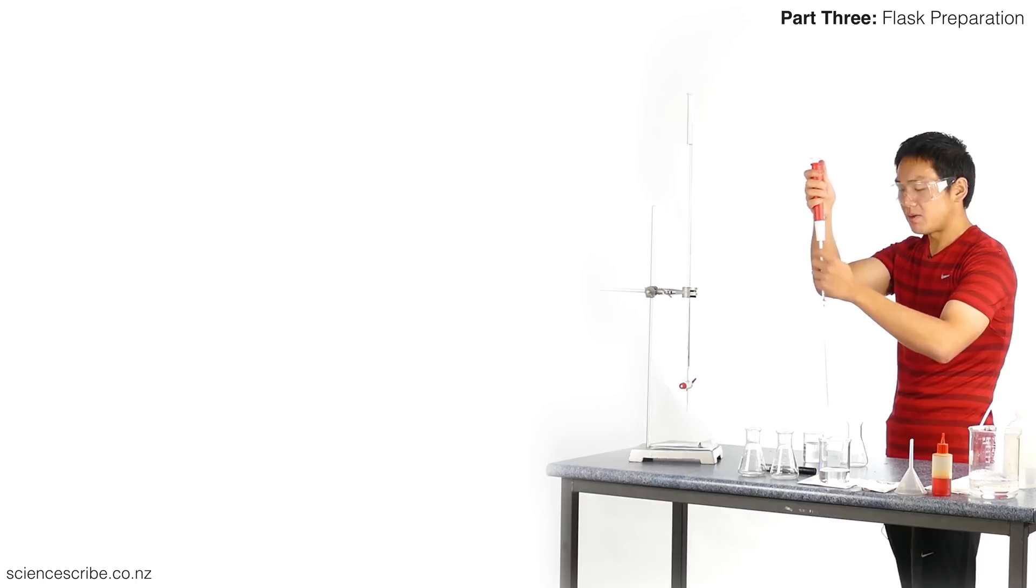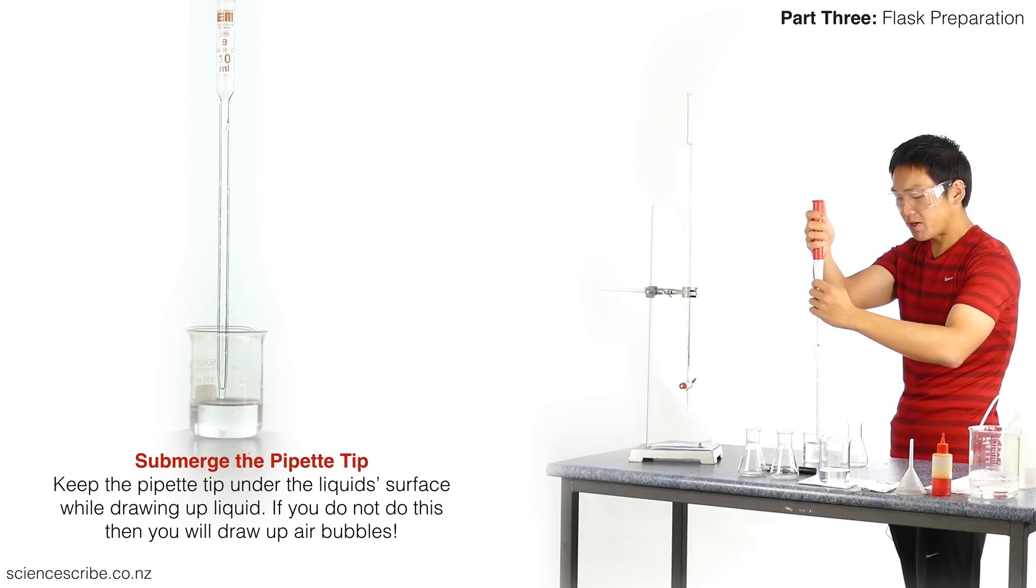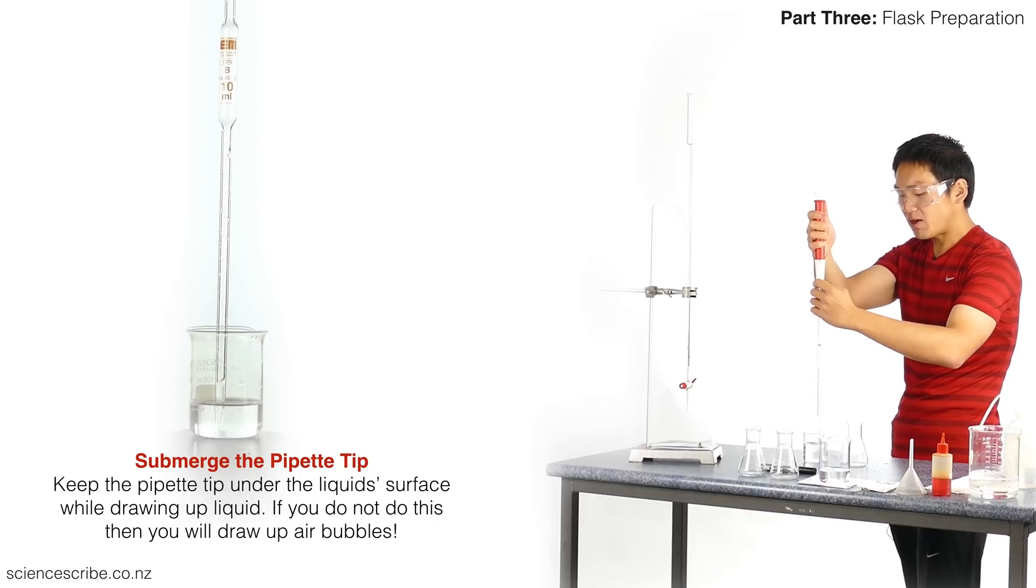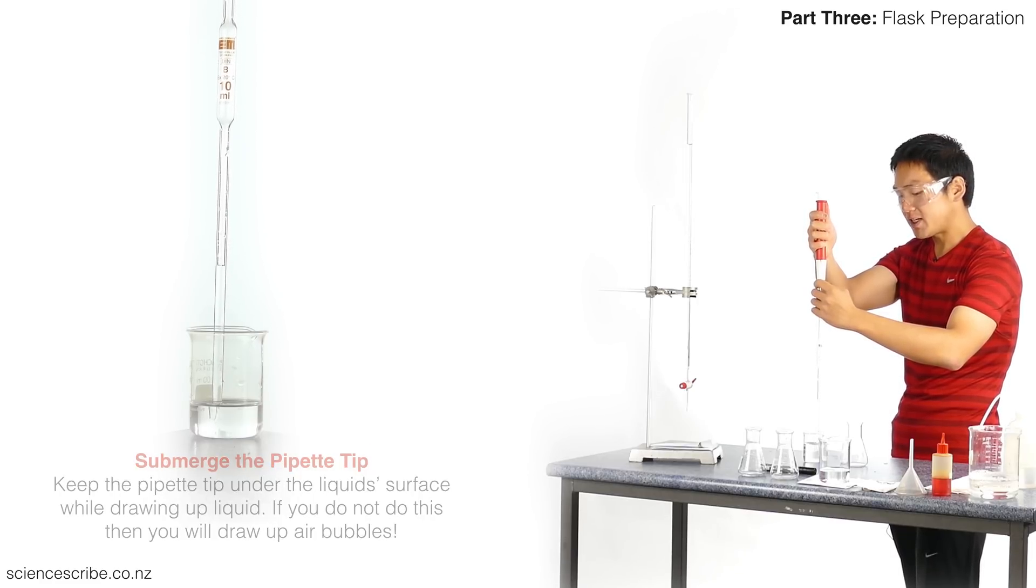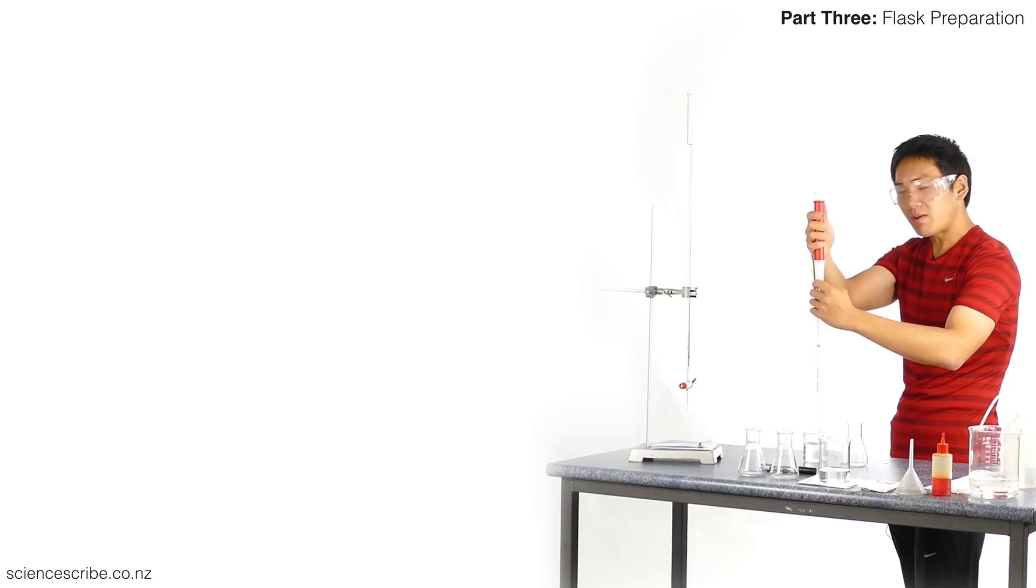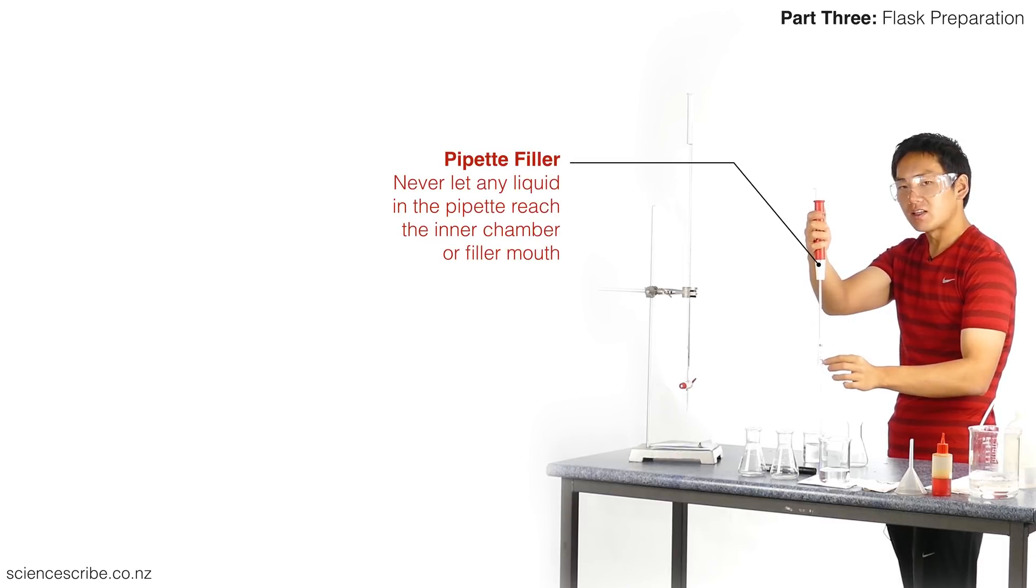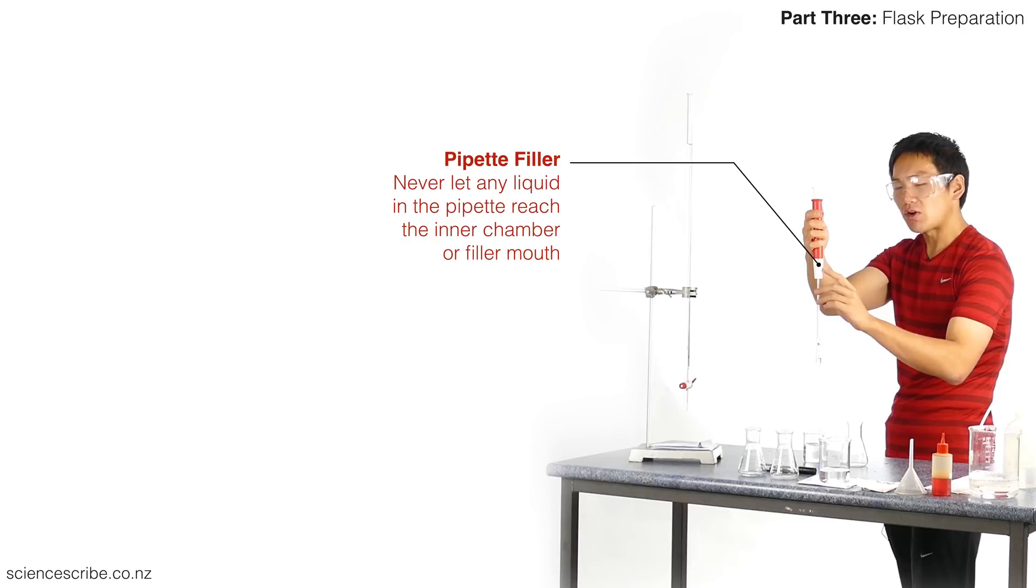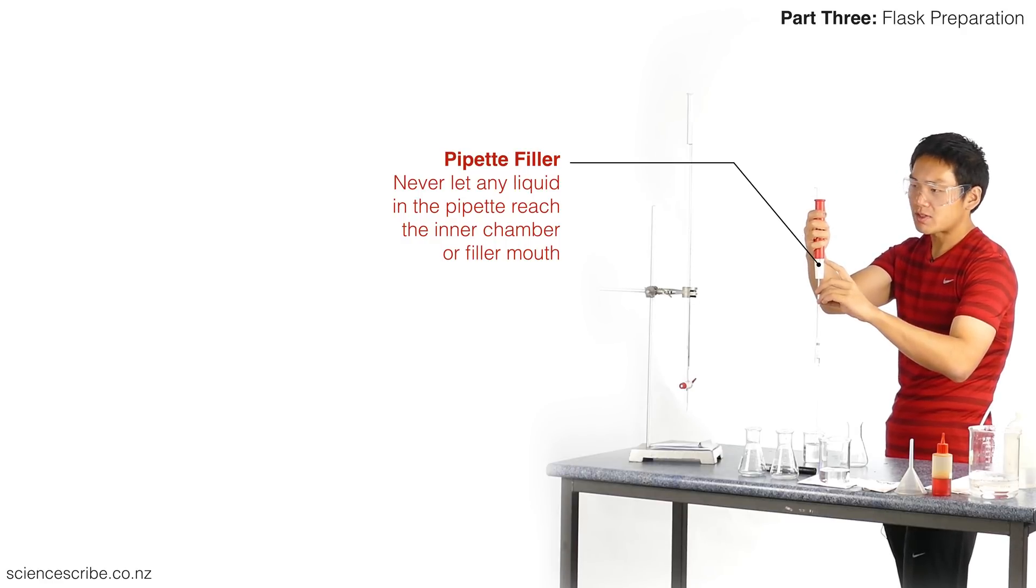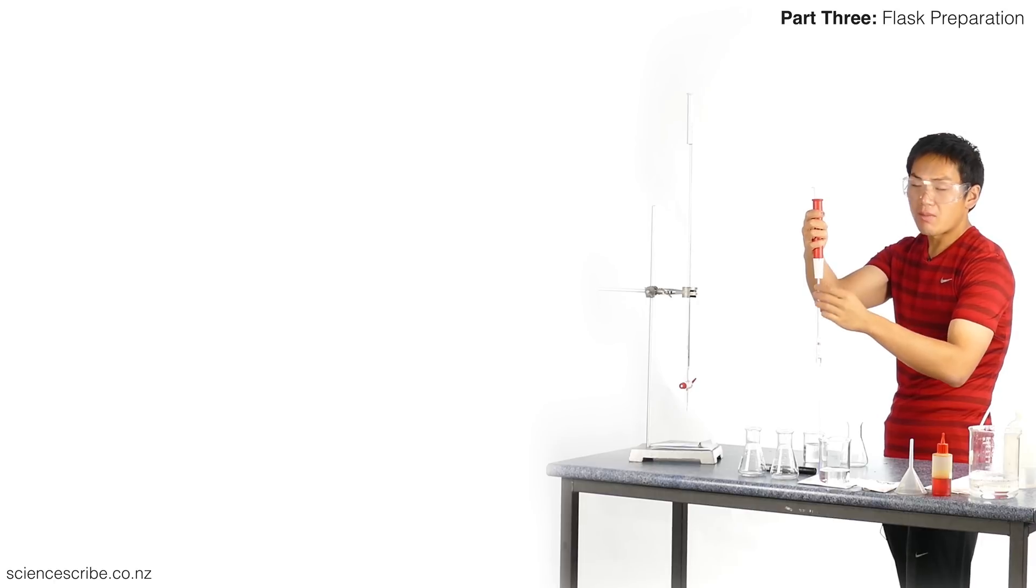I'm going to slowly draw up some of my sodium carbonate. Notice that I want to keep the tip of my pipette submerged in that beaker because I don't want any air. If I get any air bubbles in my pipette, then I have to remove my pipette filler and start again. Also, as I'm pipetting up, none of the solution should ever be drawn so far up that it reaches inside the pipette filler. I don't know what other person has been using this pipette filler—maybe they've drawn other contaminants up into it.